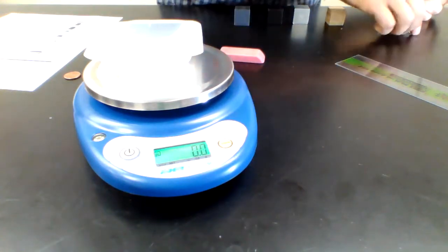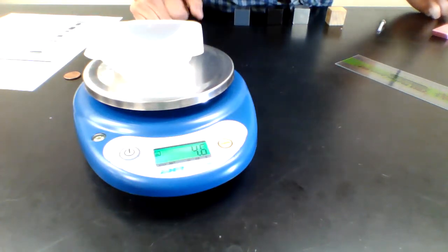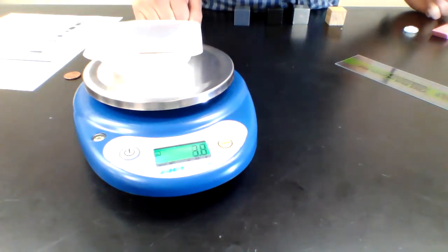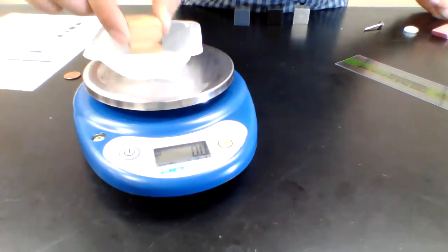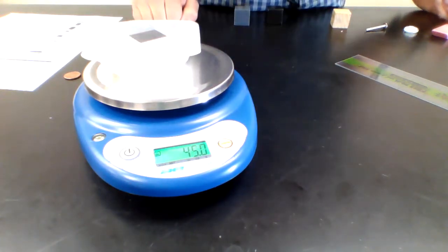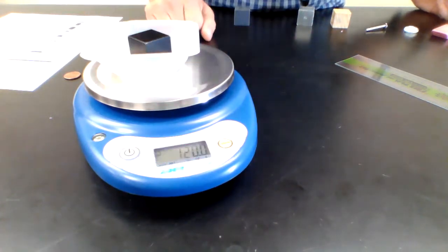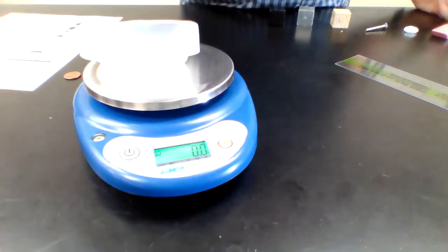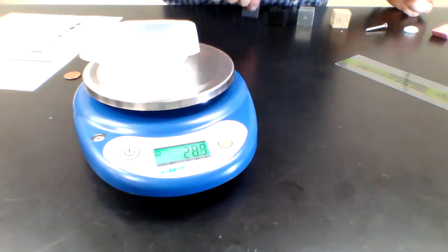You can see the eraser is 24.5 grams. Go ahead and place that gemstone. You can see it's about 4.6. I'm going to place that screw, 3.8. Place that pine wood. There we go, it's about 8.2. And then I'm going to place the aluminum. It's 45. Then I'm going to get that iron, that's 127.8. I'm going to get that nylon. So that is going to be 21.6. Good. All right.